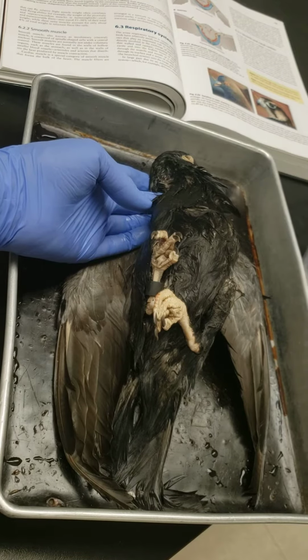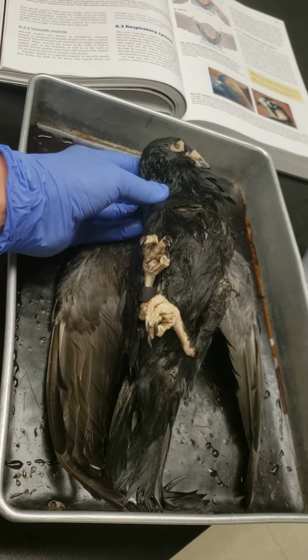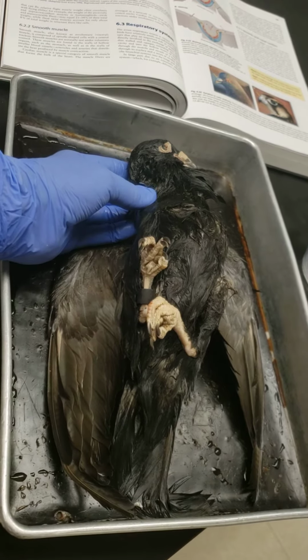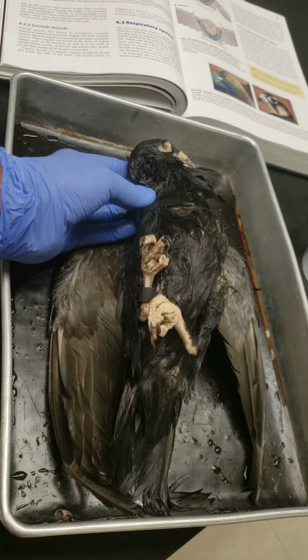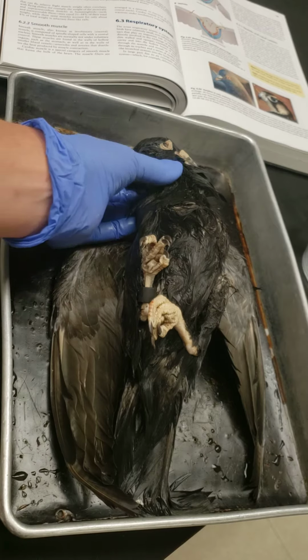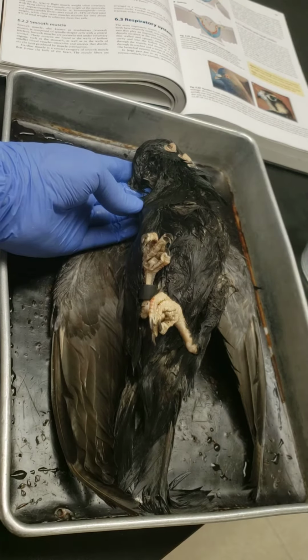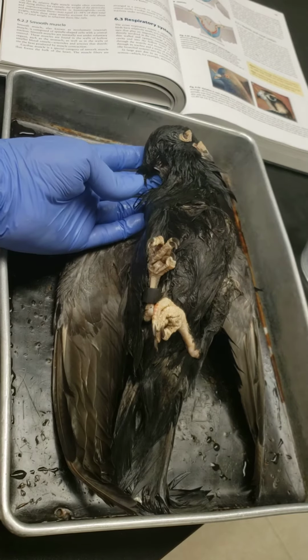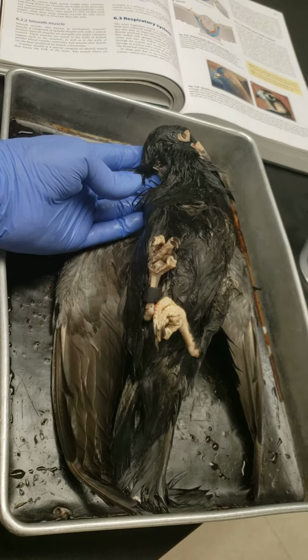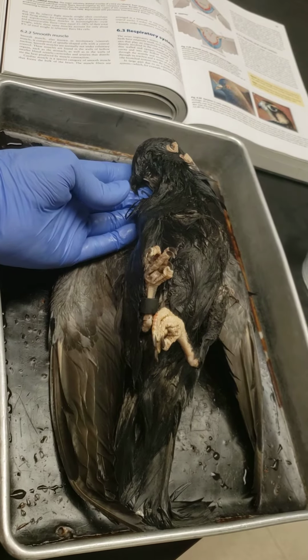Okay, so we're going to dissect a pigeon here. And just before we begin, a quick word about dissection. I'm a big fan of birds, and so it may seem strange to be dissecting a pigeon that was probably raised just for this purpose. My goal in doing this is not that you'll come to see birds as expendable in any way, but instead that by learning about the bird's body, you'll have a deepened sense of wonder and connection to birds.